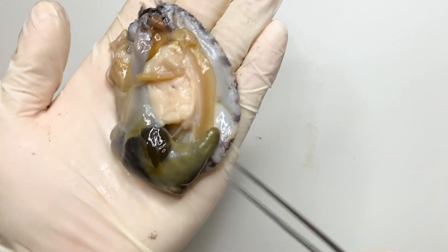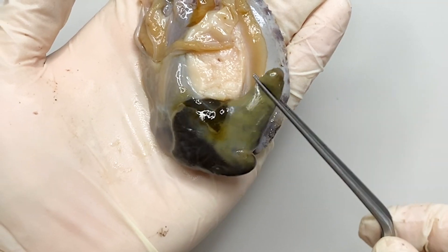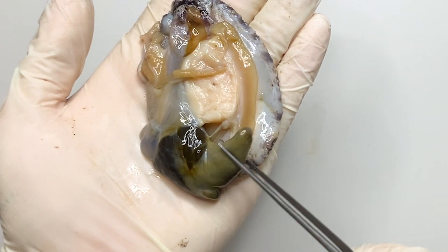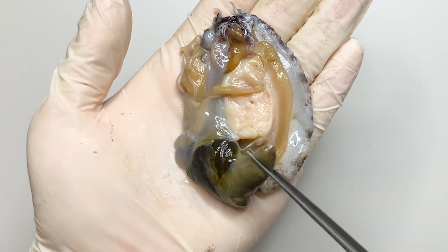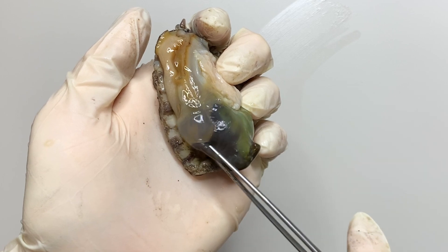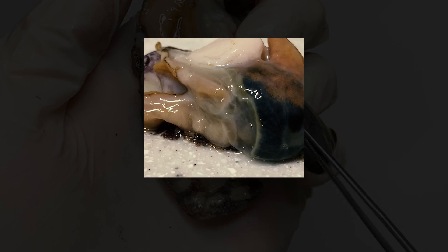The horn-like organ at the bottom is the gonads of the abalone. If it is green, it's female; males are in beige color. The gonads of abalone surround the liver, so the liver is located inside the gonads. Lastly, the transparent part here is the heart of the abalone. The heart contracts and relaxes like this.